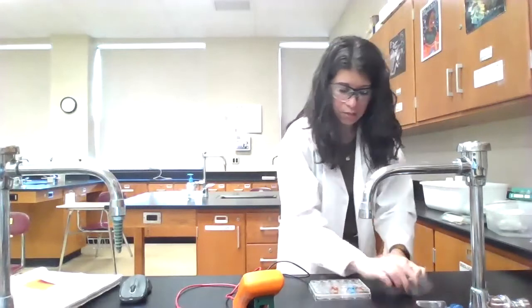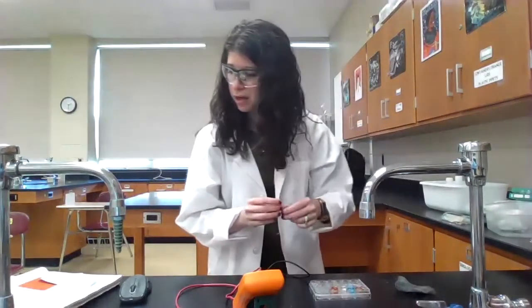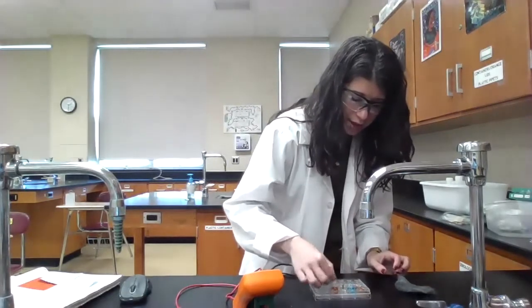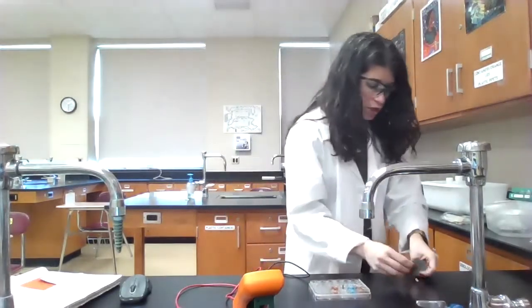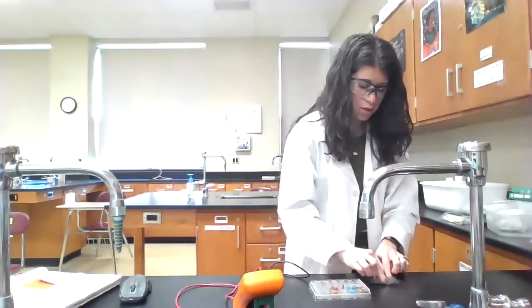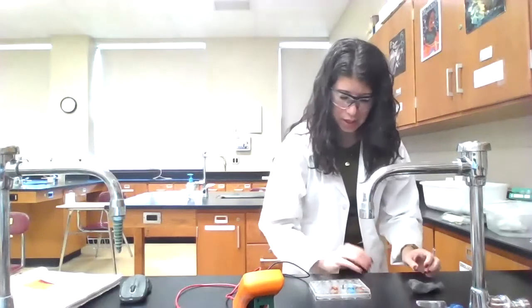So that's why I really want to make sure I do a good job of getting off all of it there. Okay, so then I have magnesium in this one here. And then again, let's just in case, clean off the silver. Each time, make sure there's no oxidation that's hindering good surface contact here.